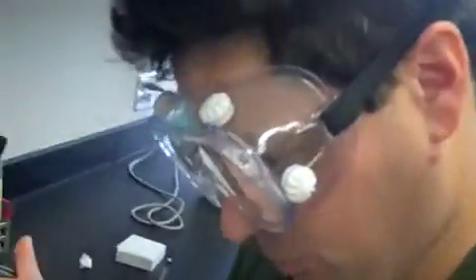I have already weighed the beaker, so I am now recording the mass of the beaker with the 1.44 milliliters of water, and then I will subtract the initial mass of the beaker from that to get my weight of the water. So the mass of the water is 1.331 grams. We know that because that's the difference in the masses of the water-filled beaker and the beaker all by itself.